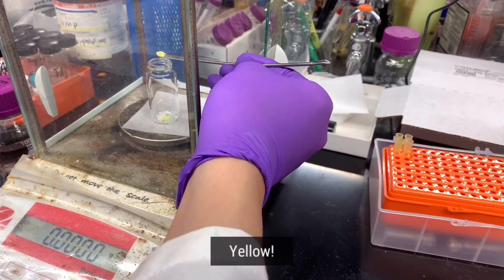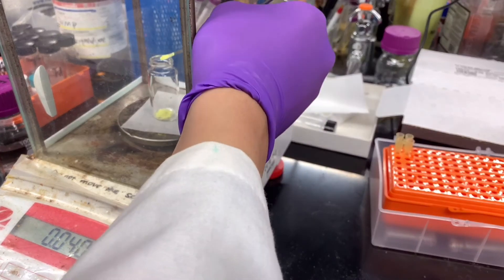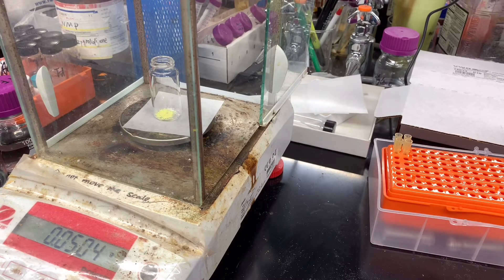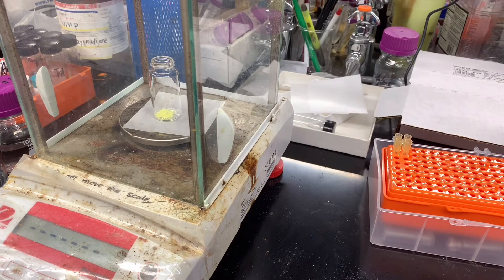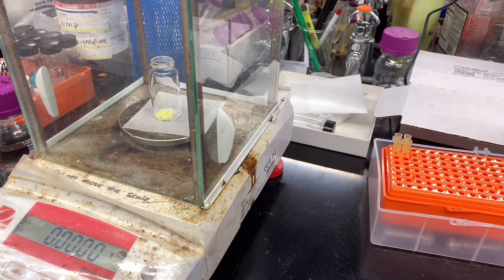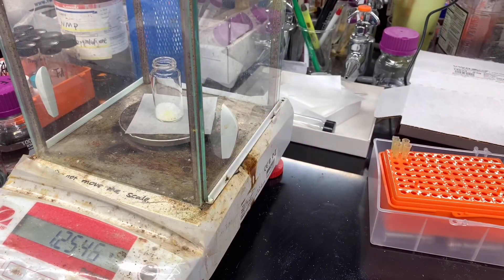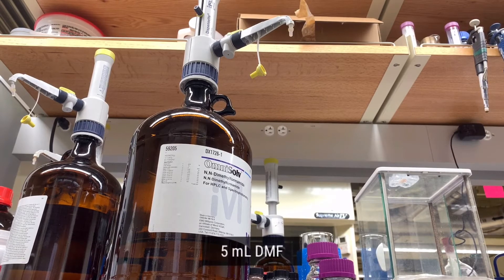Amino-BDC has a very strong yellow color. Then we need to add 1.25 grams of benzoic acid. We also add 5 milliliters of DMF to the mixture.